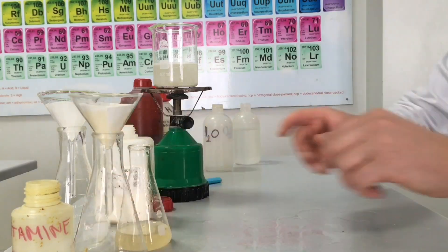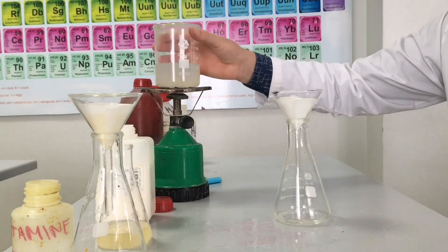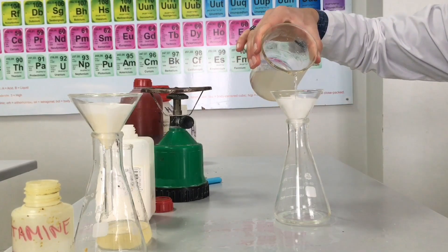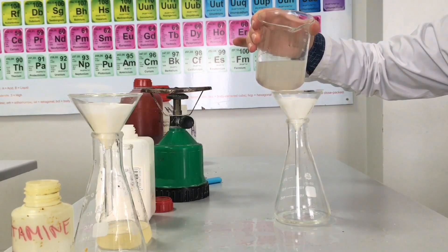We have to filter the solution of starch and the solution of vitamin C because we need a colorless solution.